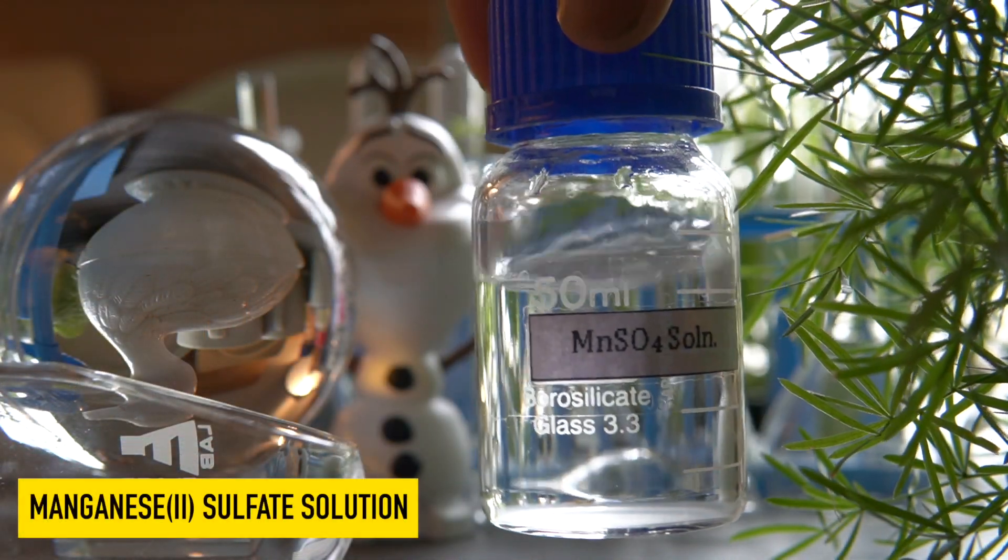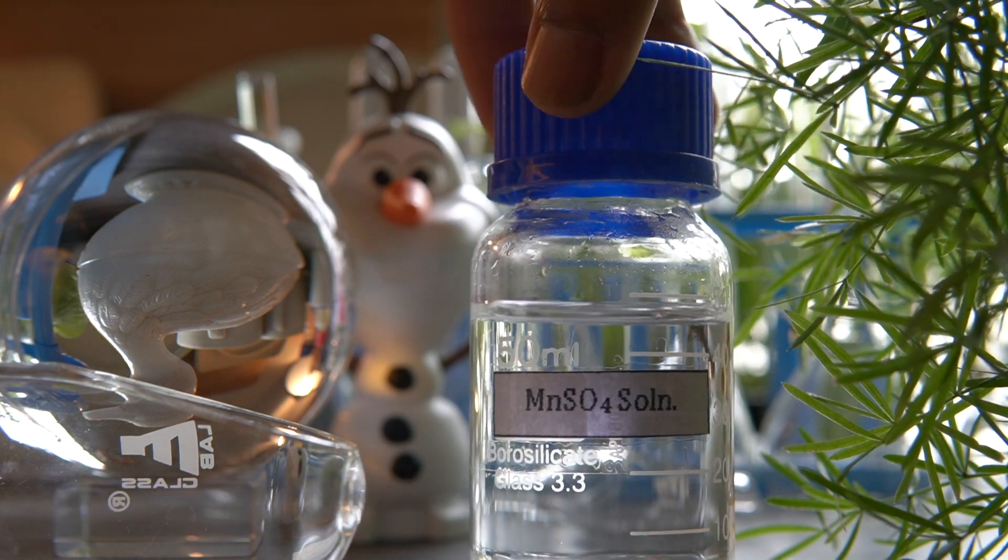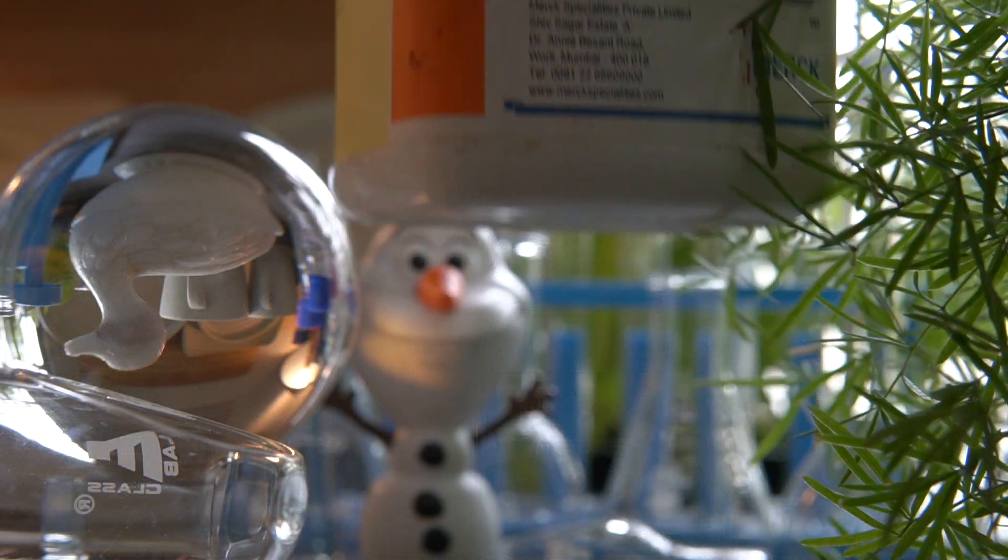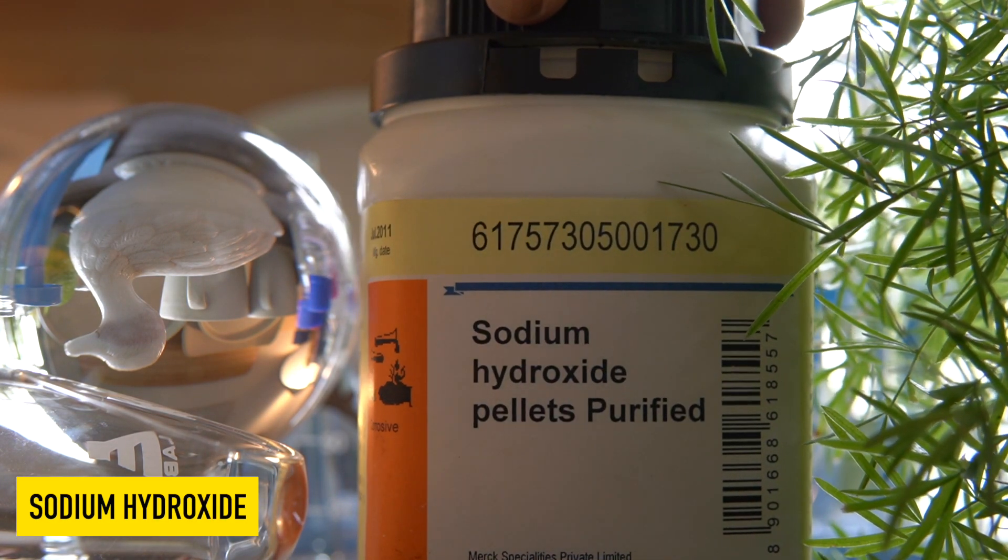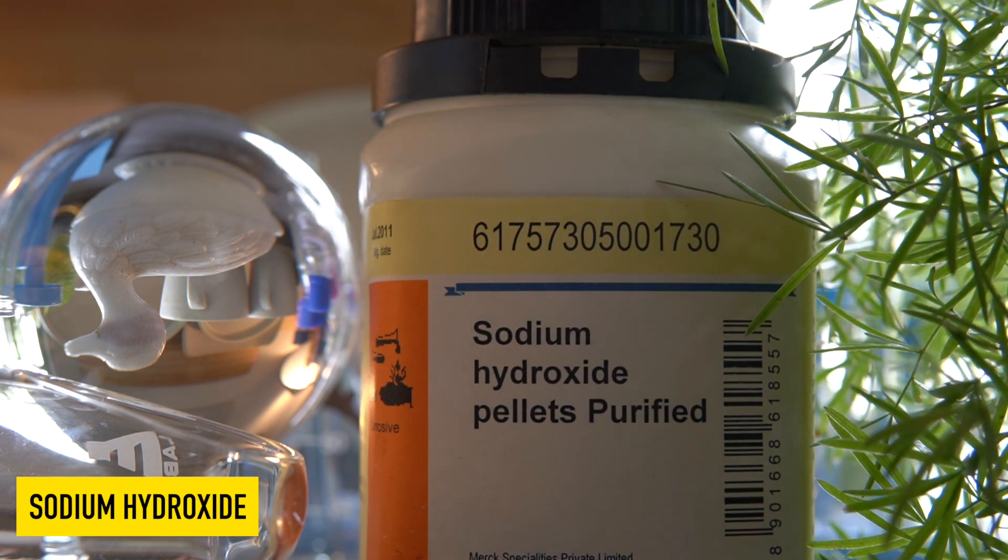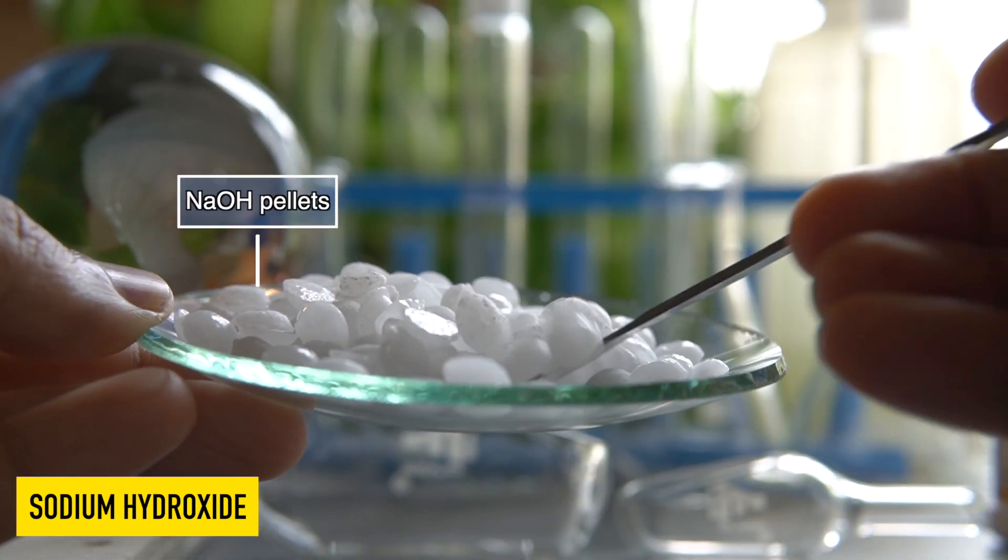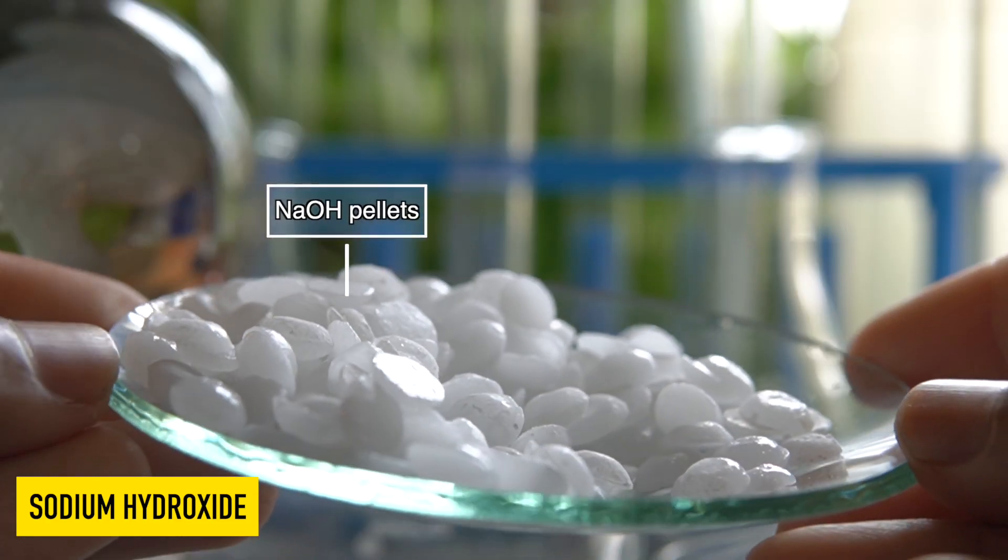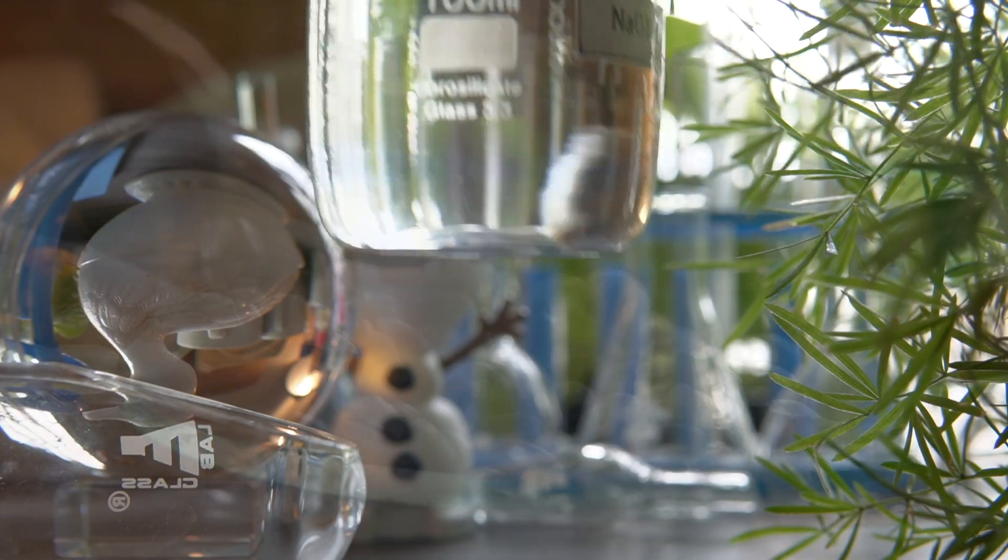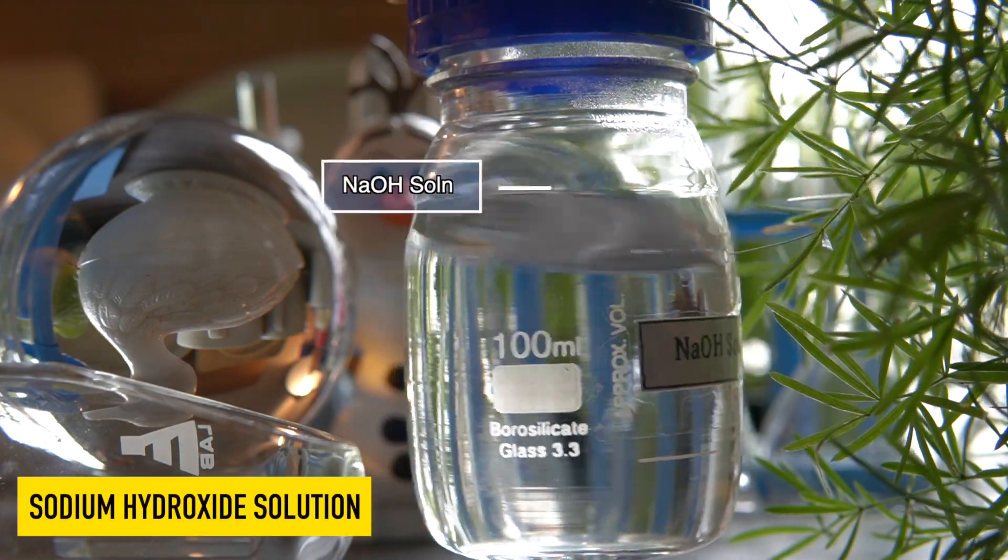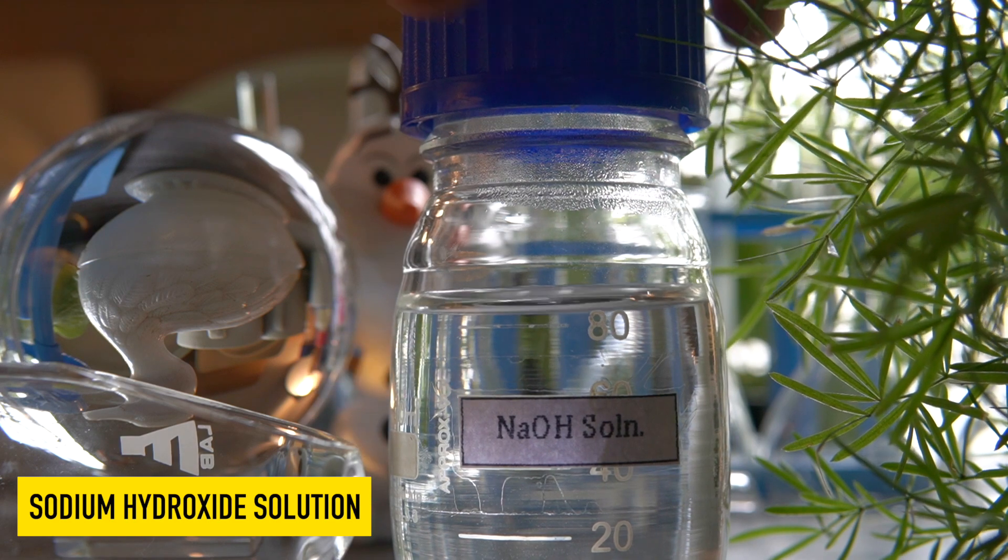This is sodium hydroxide. The sodium hydroxide pellets are a hygroscopic substance. The reaction of these pellets with water is highly exothermic, and they can easily dissolve in water to make a homogeneous solution.